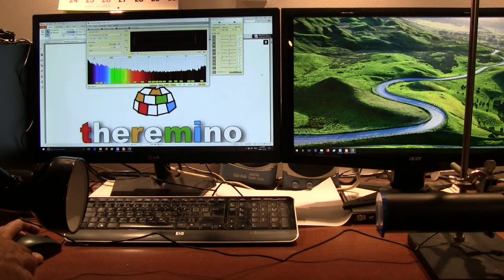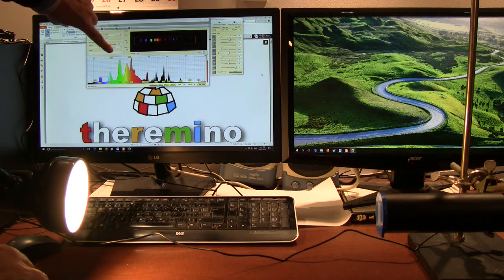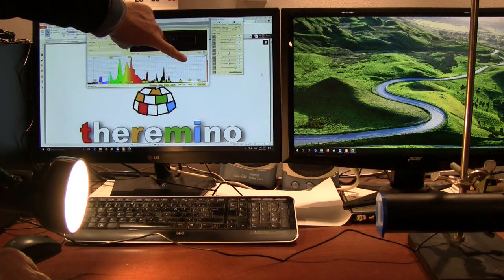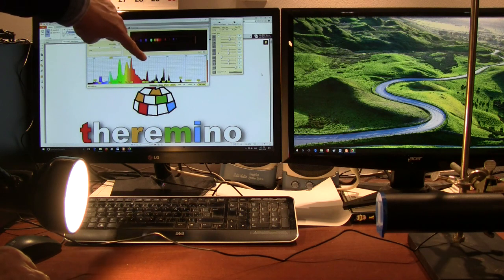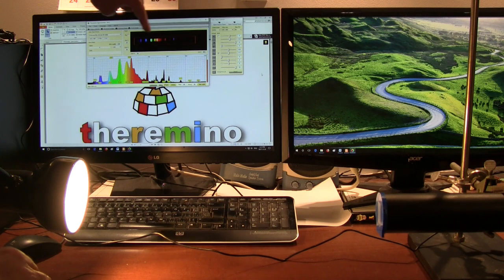All right, so I've now switched this over to the visible IR version using the Microsoft HD 3000 camera. And I'm just going to turn on the fluorescent bulb, and we can see now the same spectrum, but now we get lots of IR lines showing up here, all the way up into the 900 range. And these will slowly disappear as the bulb warms up, but you can see that there's much broader spectral lines that we can observe here, all the way up from, let's say, 370 to almost 1,000. And you can see they're starting to disappear there now.